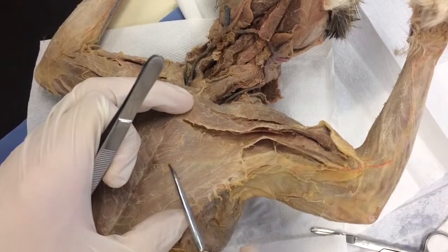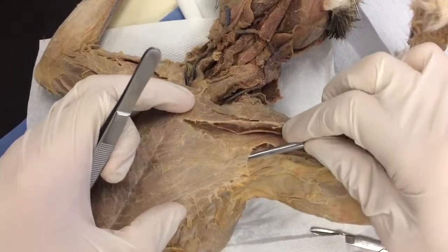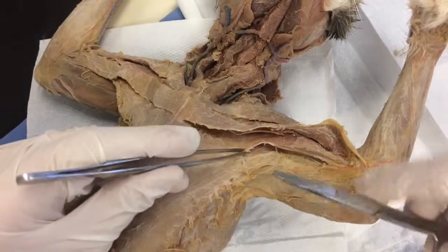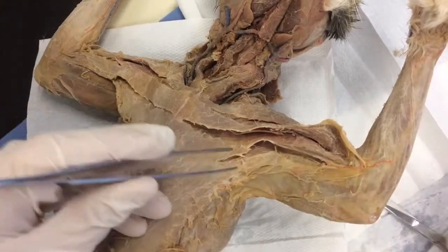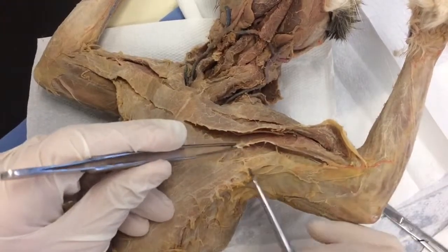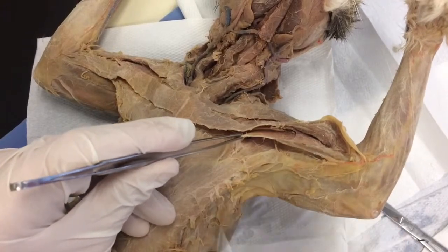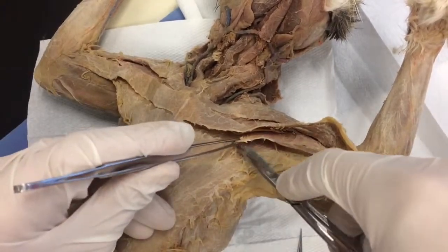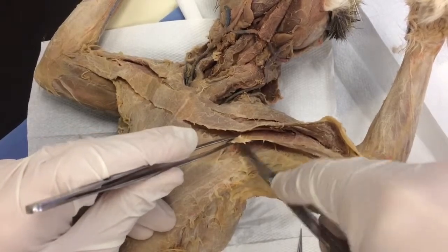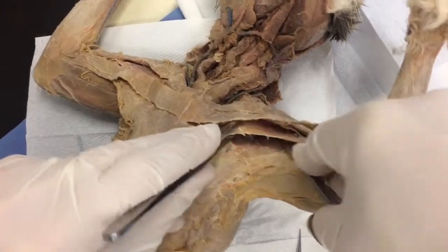Here's my line right there. I'm just going to put this probe under there and I can see the edge. I pulled on that a little too heavy — sorry about that. Make sure I don't get under minor here. Keep your depth the same — it's going to get a lot harder over here. Baby nip and a push down, and then you can really see the separation.